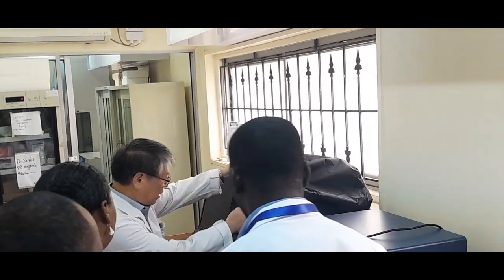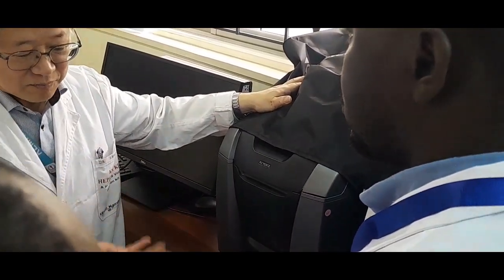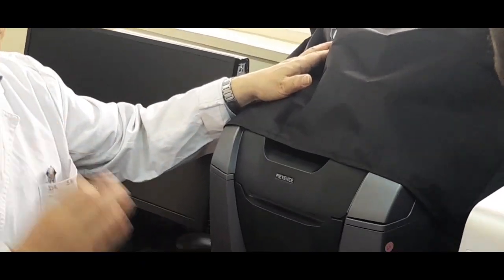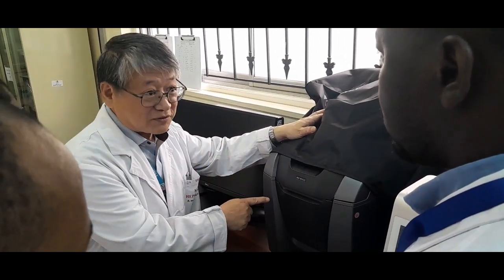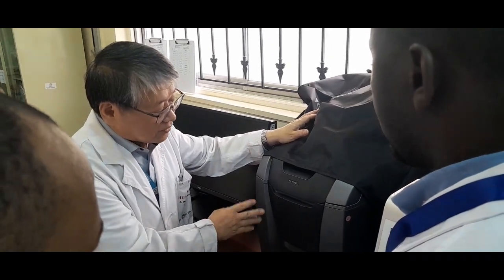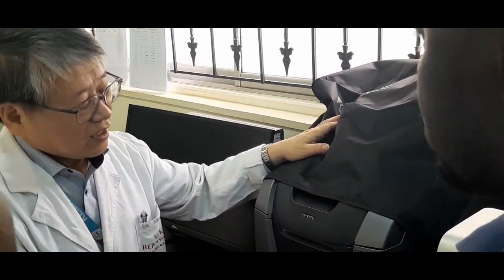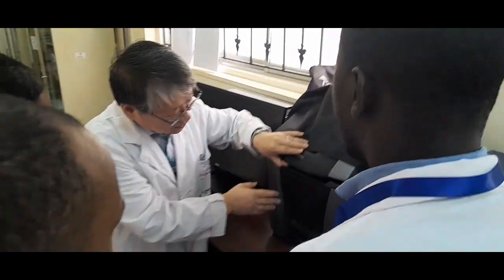And then also here we have the fluorescent microscope. So for detection of virus or some microorganisms inside of the cells, or the presence of antibody, by using the immunofluorescent antibody technique, we can observe. It used to be that fluorescent antibody techniques worked inside of the dark room, wasn't it? But this one is very sensitive.